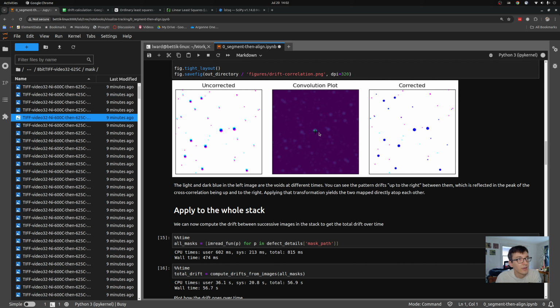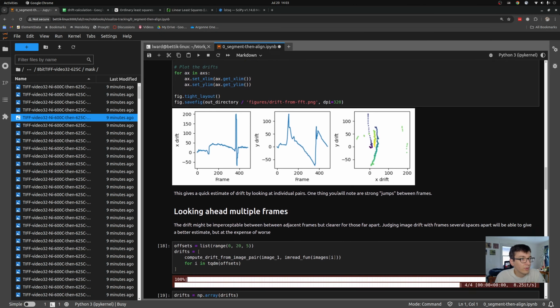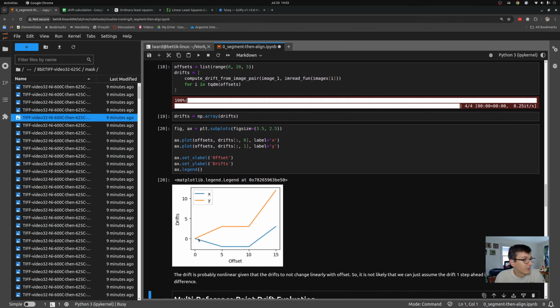Not only is there a possibility of multiple explanations of what the best drift correction could be. That's one potential issue. There's also some noise added in here from the fact that these segmentation maps are created using a machine learning model and the idea that sometimes the true drift may be smaller than a pixel. So we can't actually resolve it between two adjacent frames. Instead, what we could do is look at frames that are farther apart. I could look, say, instead of next to each other, every 5. And here I should have a more reliable picture because that drift is larger, and thereby I can measure it more accurately in theory. So you could imagine I could build my drift as a function of time by computing every 5 and combining them together to form a time series.